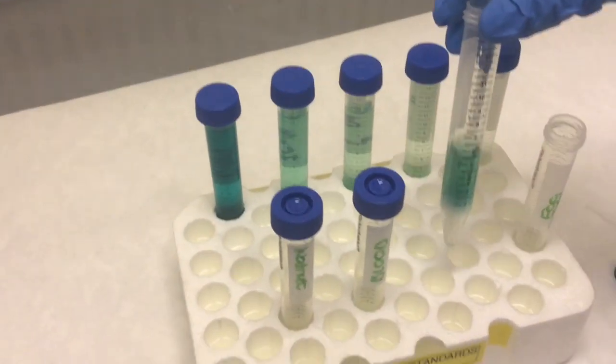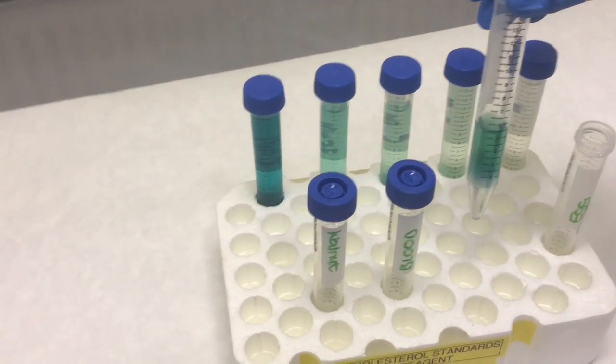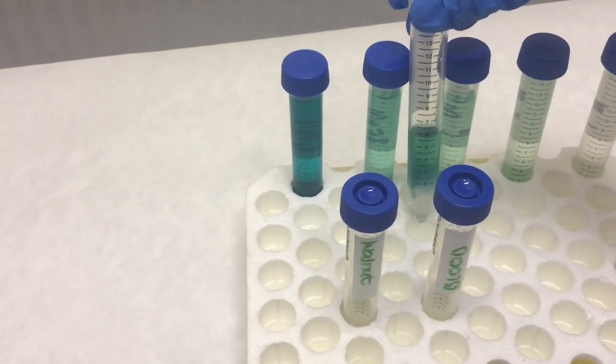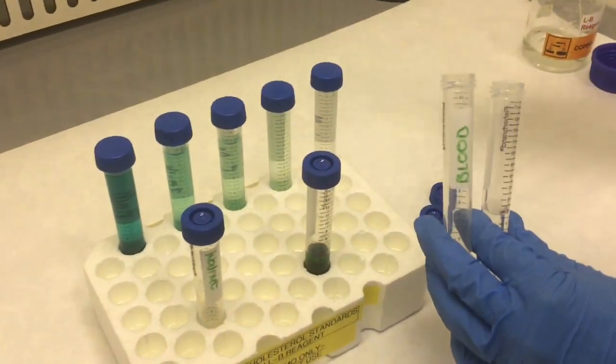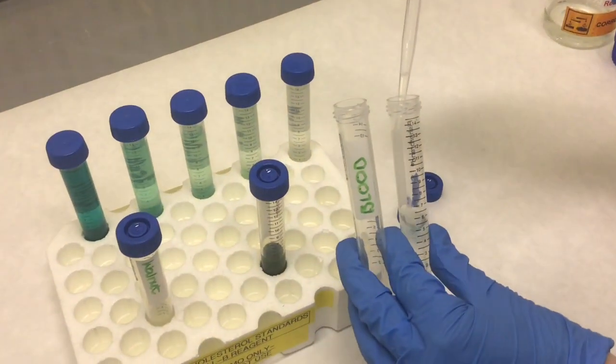The colors can be easily compared to the colors seen on the calibration curve. The same procedure is then performed for both the blood and walnut extracts.